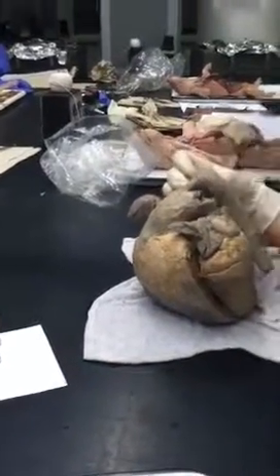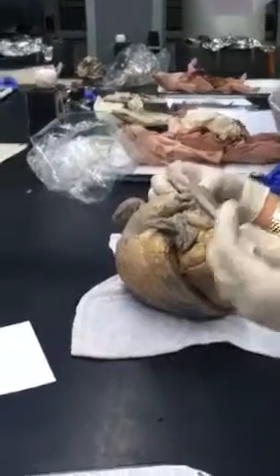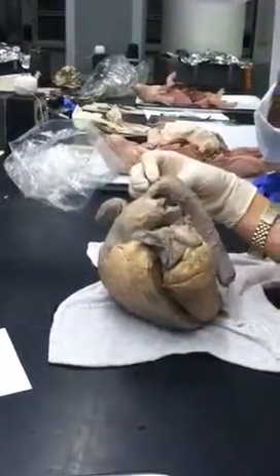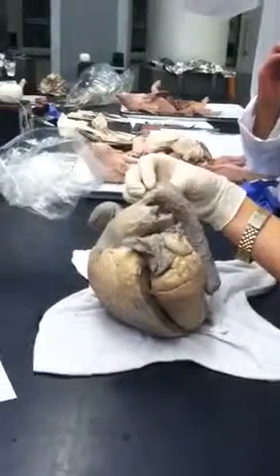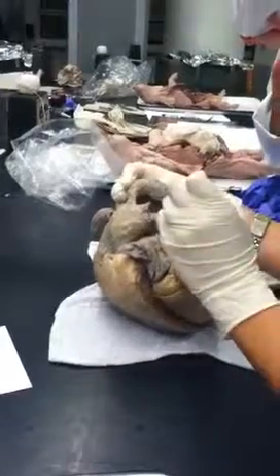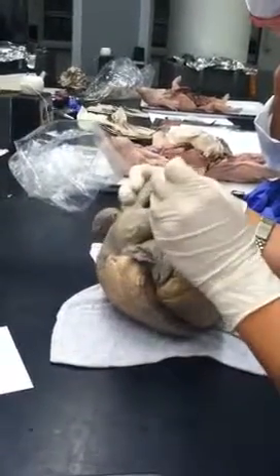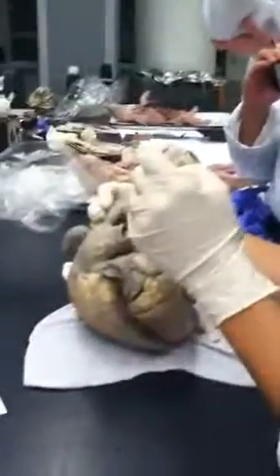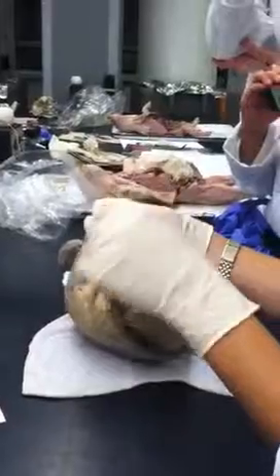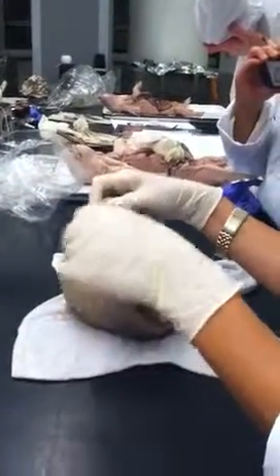So pulmonary arteries, and then these go to the lungs. Good. Then there's a whole bunch of stuff that you'll learn and need to recognize for trace questions, but basically it gets oxygenated, and then it comes back. Is one right, one left, or do they both go to both? Yeah, one of these is left and one is right, but we don't ask you to know that. So they split up, one goes to each lung. I would assume that's left and not right. Yes, sorry, I forgot that was the answer.